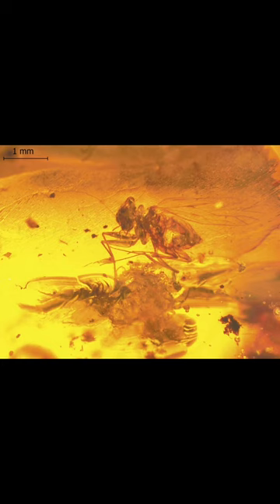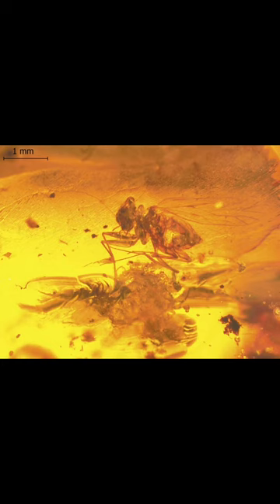It can magnify a fossil up to 35 times in regular view, and with a little image editing, a fossil can go from this to this.